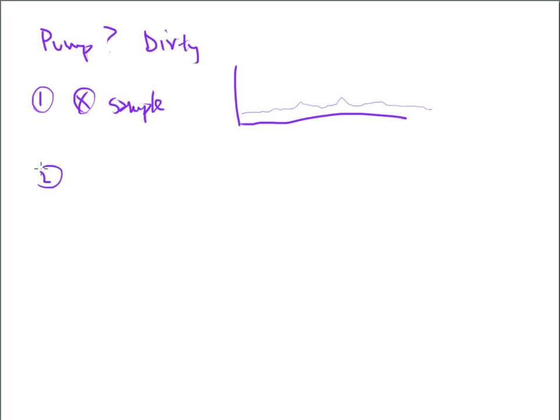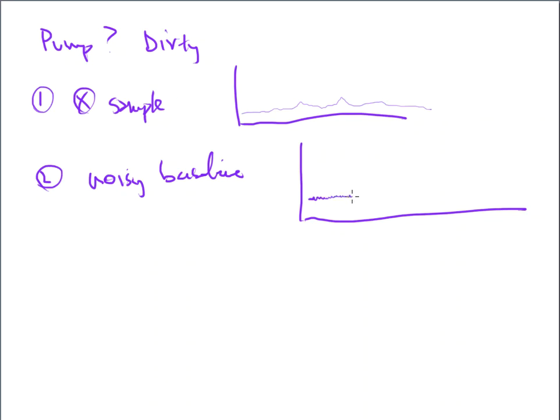All right. The next thing that you might see with a dirty pump is something that we would call a noisy baseline. That stuff can build up gunk on the inside of it. And if you take a look at the baseline, if you zoom out far enough, everything looks like a flat line, right? But on a normal working day, if you see the baseline do this jiggity jaggedy stuff on the screen, then that is a very good indication that there's gunk in the pump. And that gunk could be in the pump, it could be in the tubing, it could be anywhere. That noisy baseline is basically all of this dirtiness that's getting carried through the instrument, and it's reaching the detector.